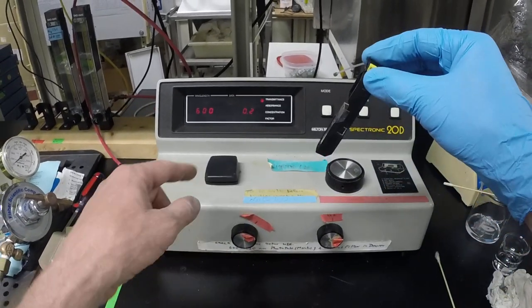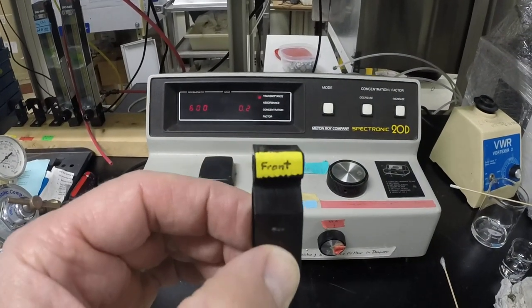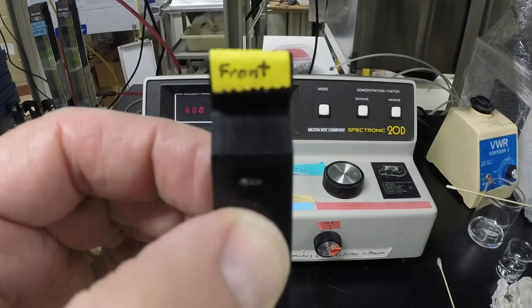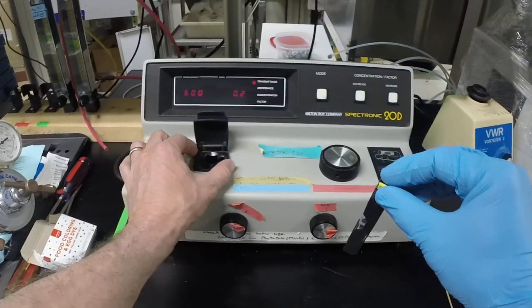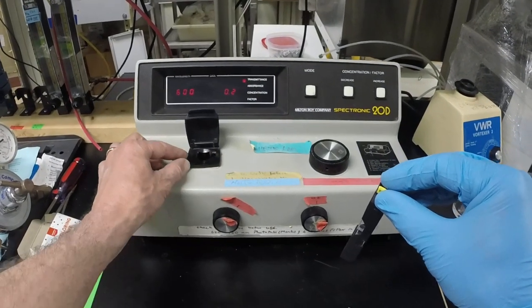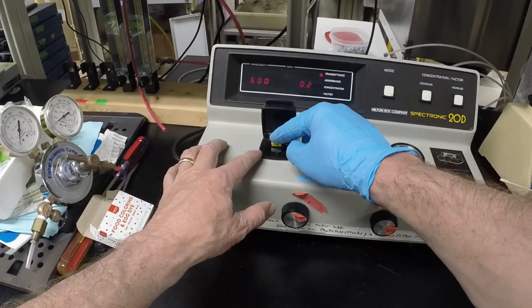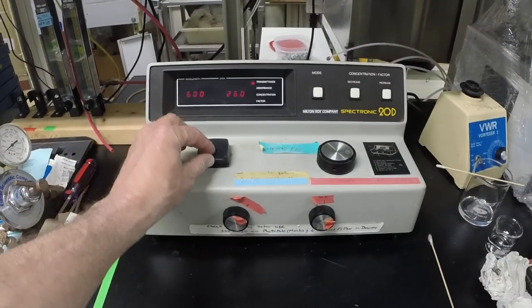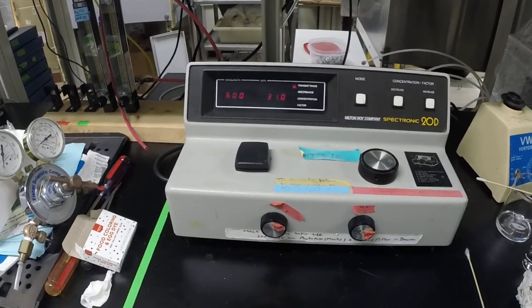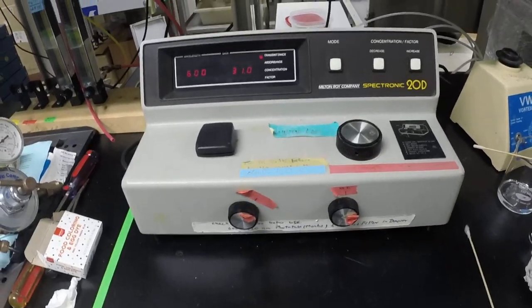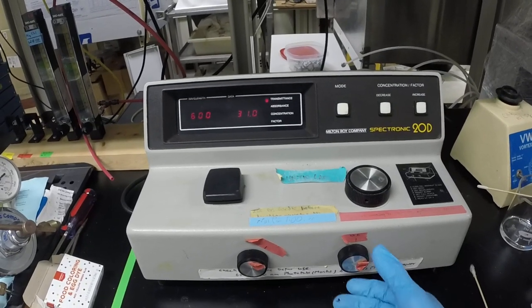Now when I put this in, it actually opens a window, and I put a little label on here to make this easier to see, it actually says front. The set screw isn't in here right now, so it's a little loose, so I'm consistently going to be holding it in one position. When you put that in there, you can see that the transmittance now is going to go up a lot higher. The number there is around 31, and we want now the transmittance to be fully spanned.